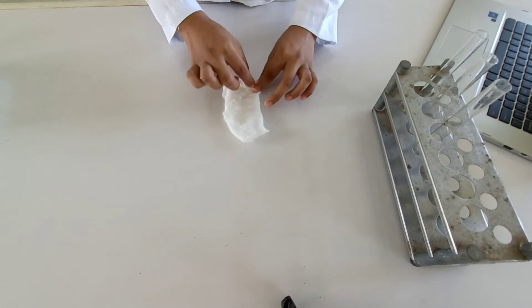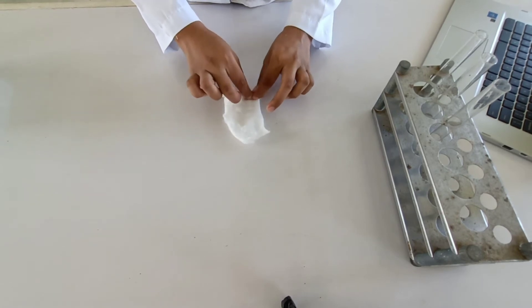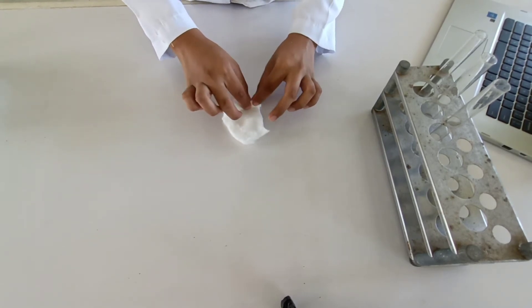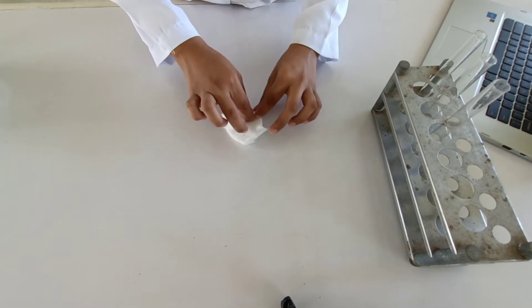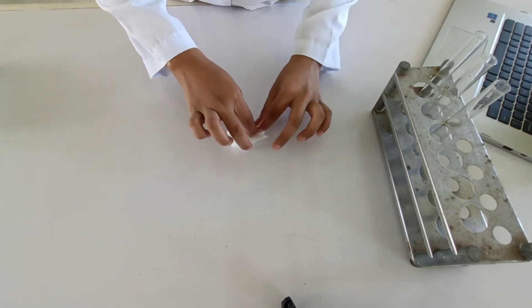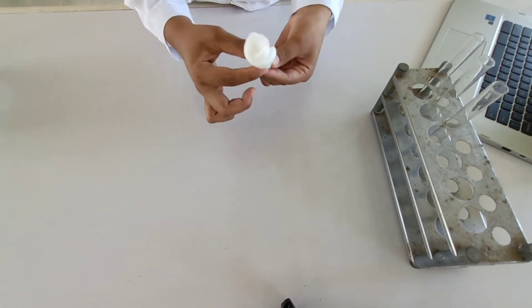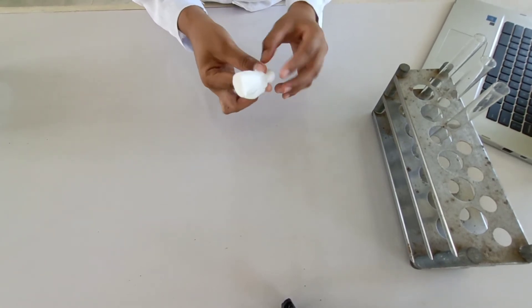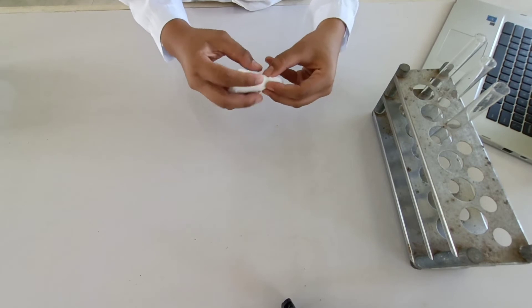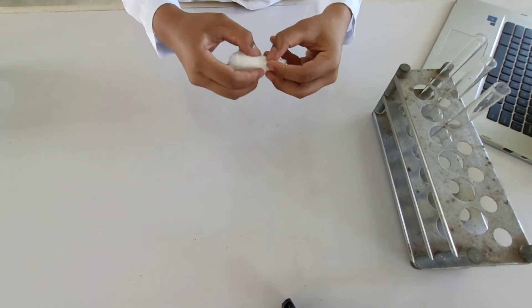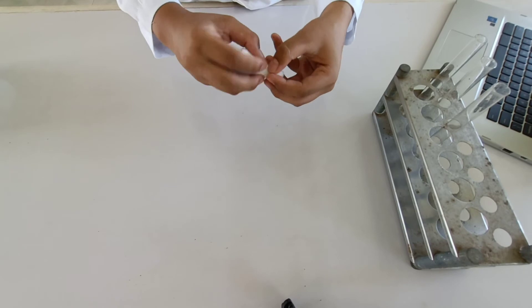Roll over this side and the other side should be puffing. Then continue to roll it until we can create a size that would fit in our test tubes. Then next, roll it between our fingers like this.